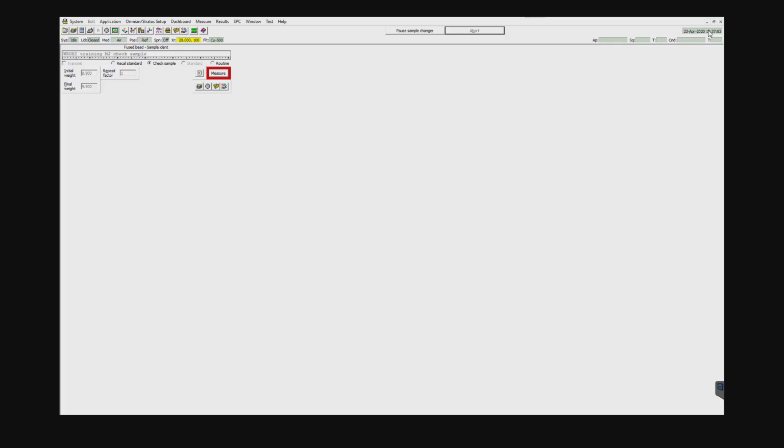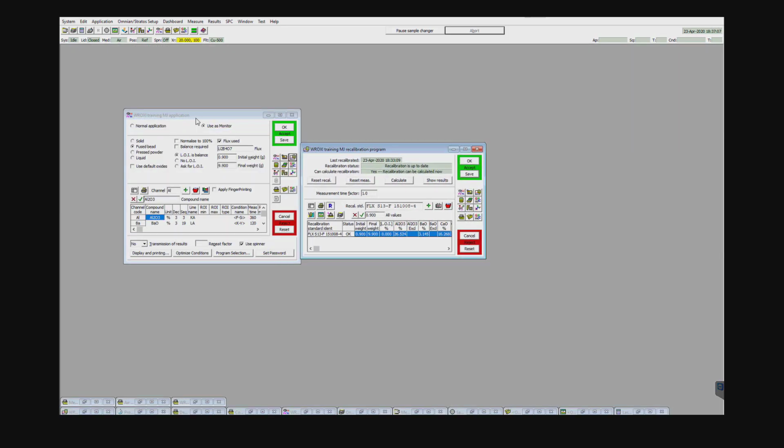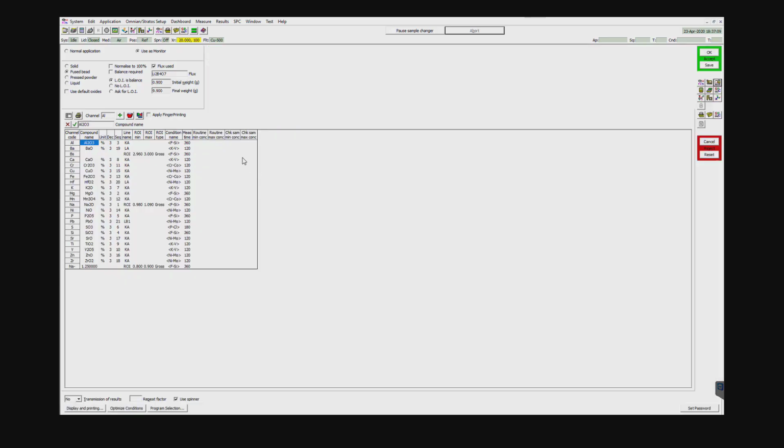The check sample, if you wanted to apply it within the application itself, you could go back to the application window, and we can set up a check sample min concentration and check sample max concentration. If it goes outside of there, you'll get a warning message about the check sample min, check sample max being compromised when you're running the check sample. If the check sample is out, it's a good time to then go ahead and run the recal sample. So that's about it for the recalibration program.